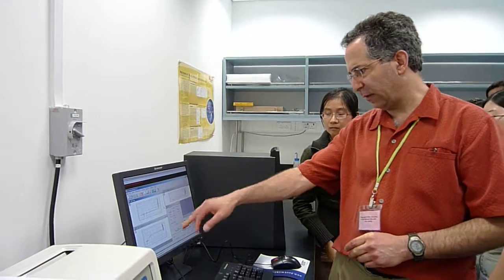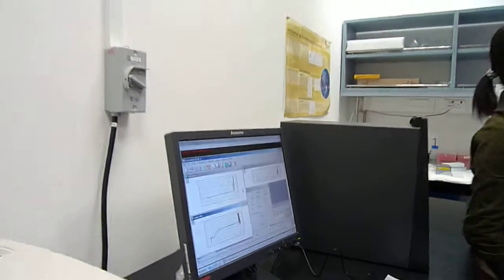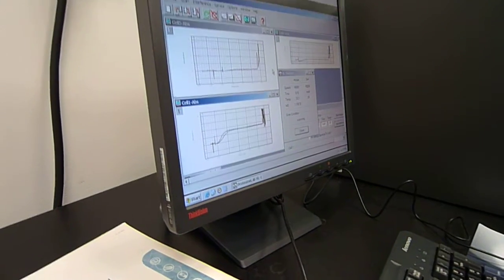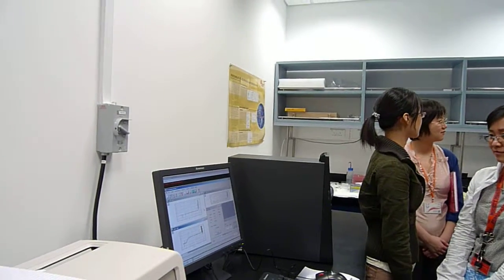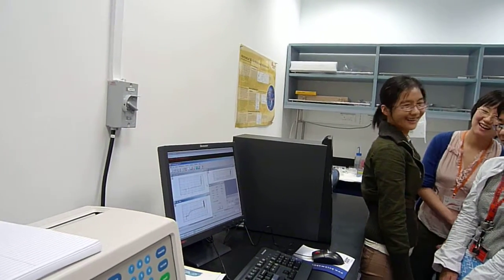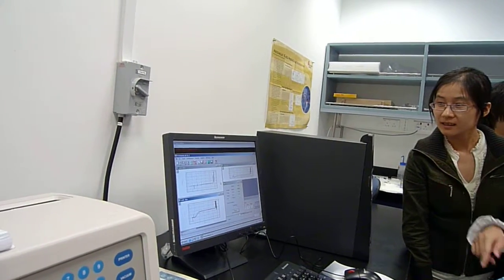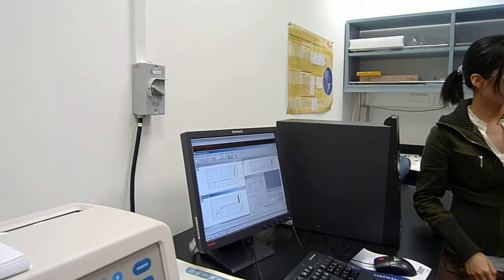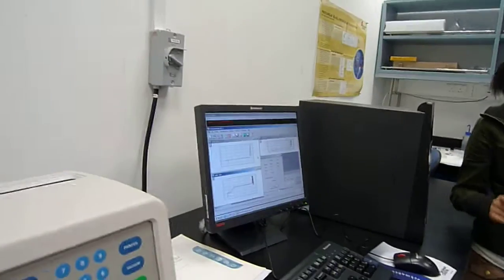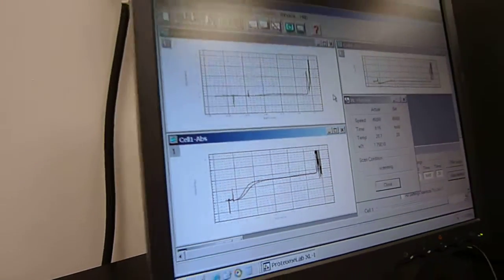As I say, it looks like this one is perfect. Oh, look how quickly. This is going to happen real fast. At this point you're sort of committed. But that's actually really beautiful. It's very nice because you get an impression in real time. It's actually sedimenting considerably faster than we would have expected for the dimer, and I guess you thought it might be more, maybe at the lower concentration.